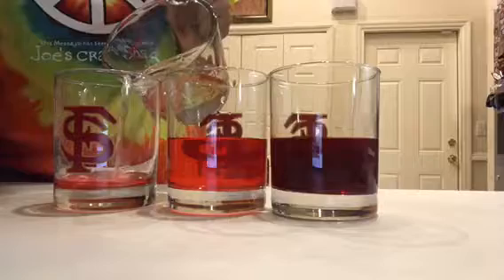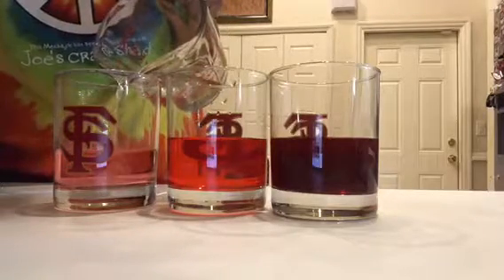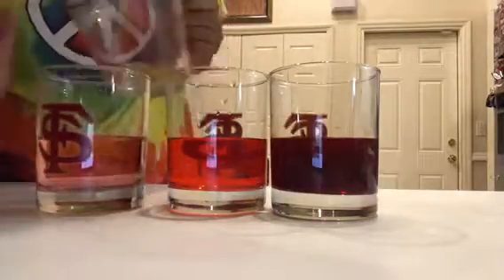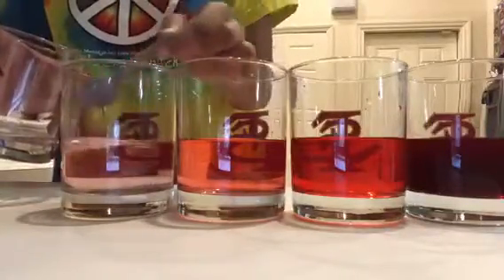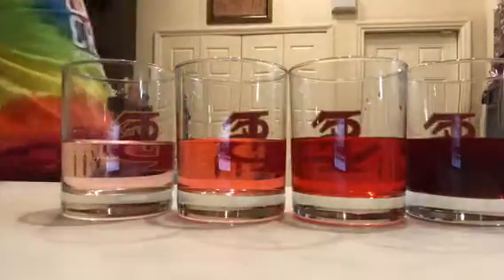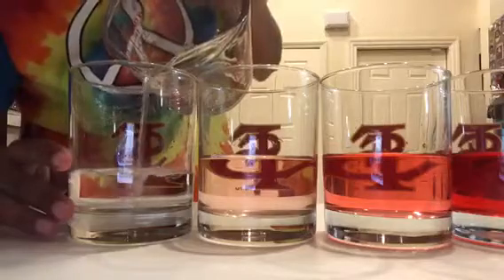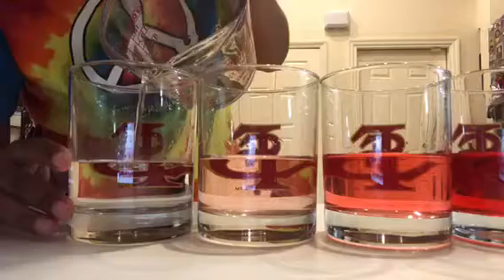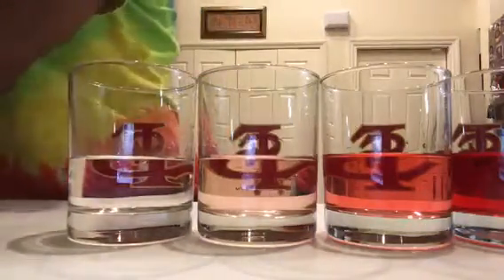You will begin to see that as the solutions continue, the dilutions increase, meaning that the amount of moles in each solution decreases. By the time I reach the 5th solution, it looks like the concentration is nothing and it's basically just water, which is exactly what we're aiming for in order to reach the parts per million concentration.